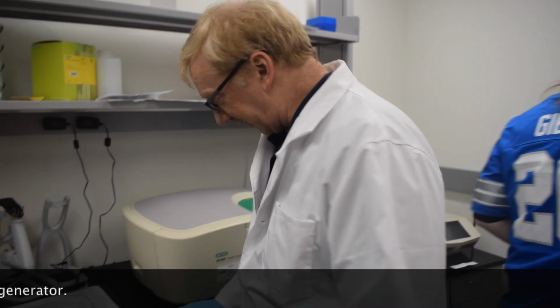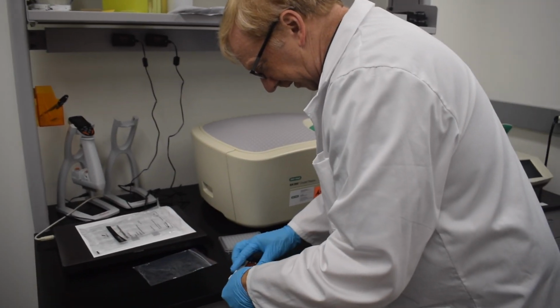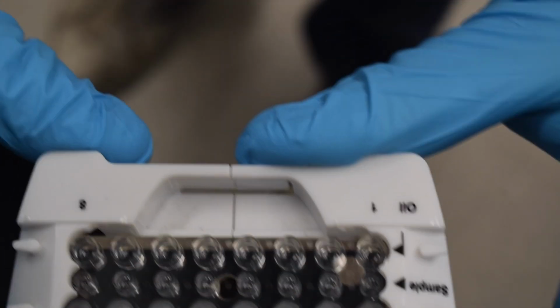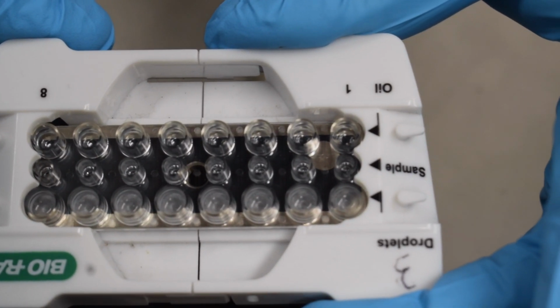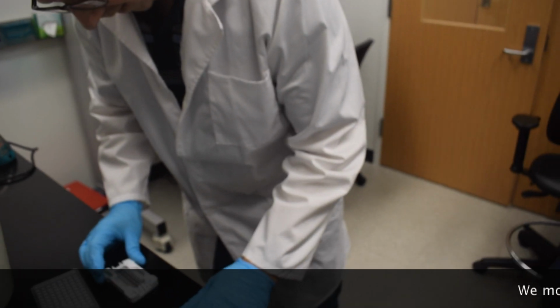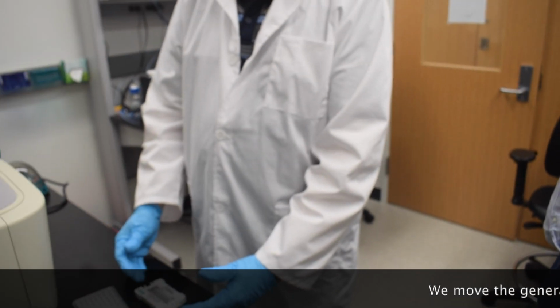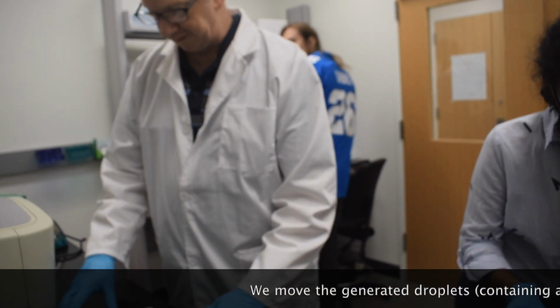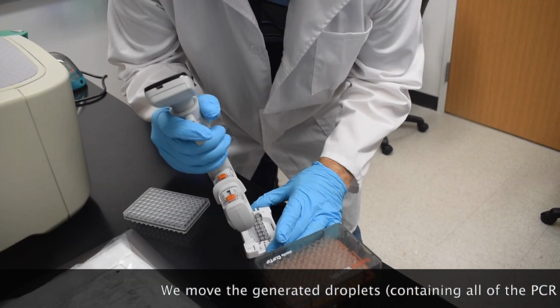Okay, so now the droplets have been generated. We remove the gasket from the top of the cartridge. The upper row is cloudy compared to the other rows of the cartridge, and the cloudiness, those are the droplets. And so now we take everything that's in that upper chamber, which is about 40 microliters, and we transfer that to a PCR plate.